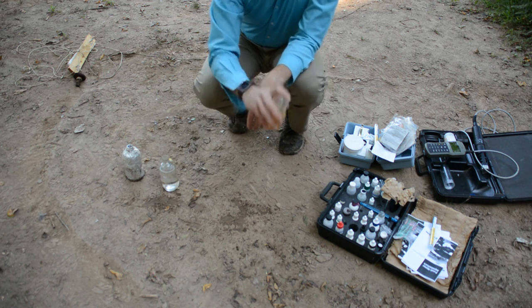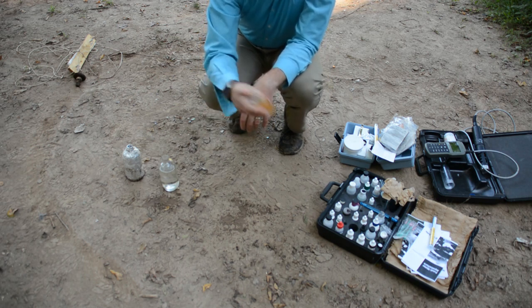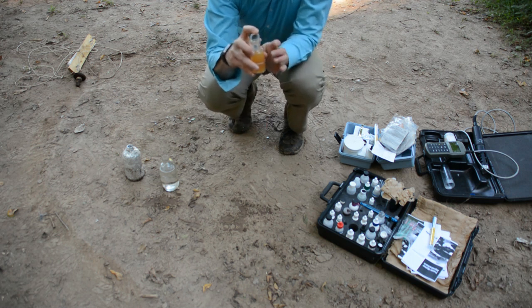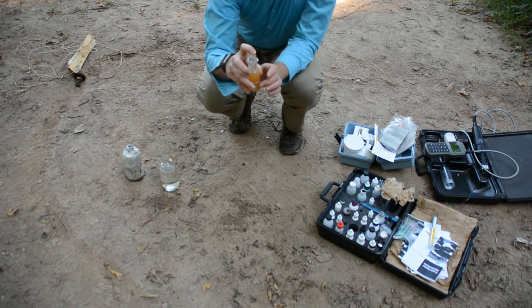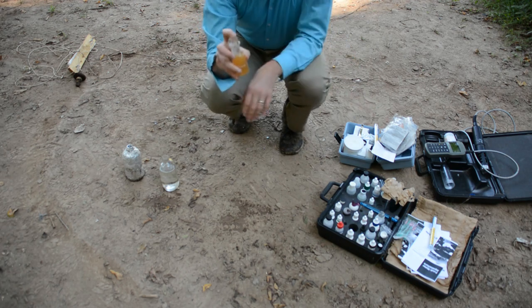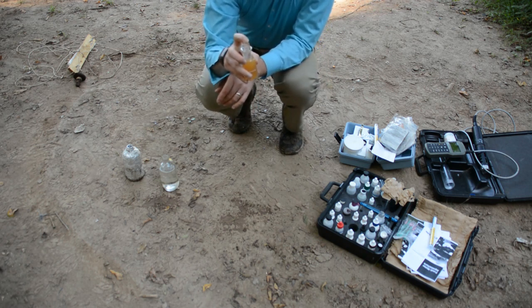All right, and what's happening right now is a precipitate is forming, and eventually we'll do a titration to figure out how much oxygen is in this sample. The Hach system uses simple pillow pack pre-measured, pre-calibrated reagents, and then we do a little simple titration to figure out how much oxygen is in there in milligrams per liter.